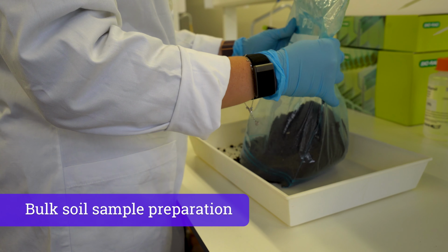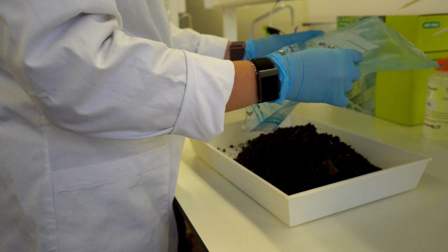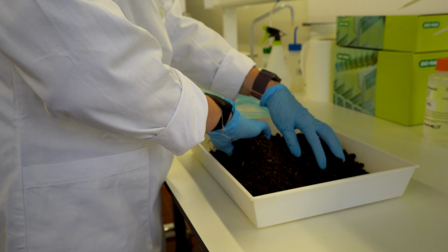Thoroughly mix the soil collected from the 5 sampling sites within each plot in a clean, dry container to obtain a representative bulk soil sample.